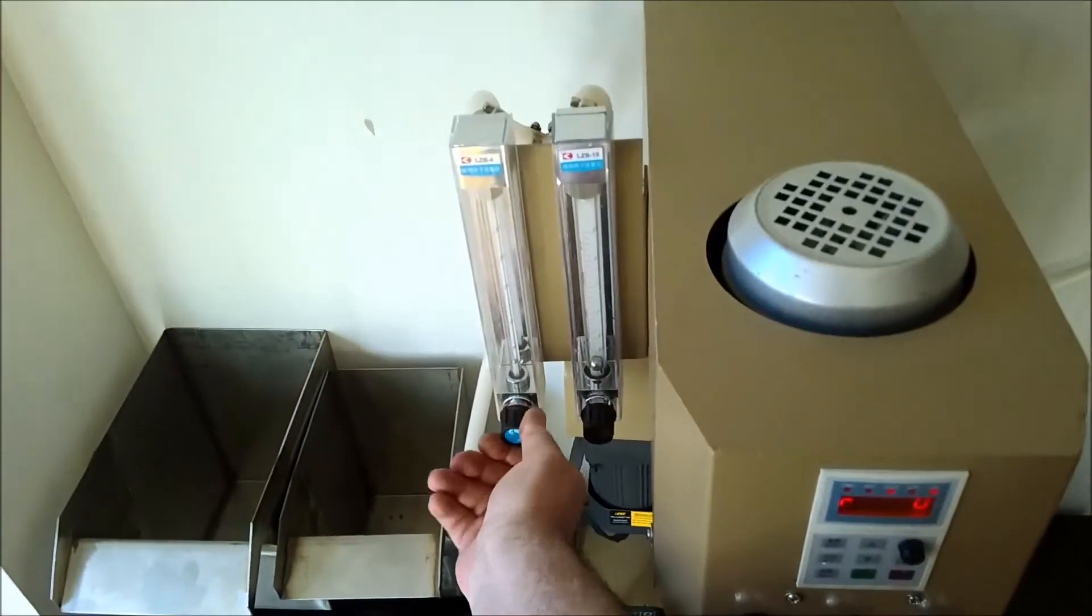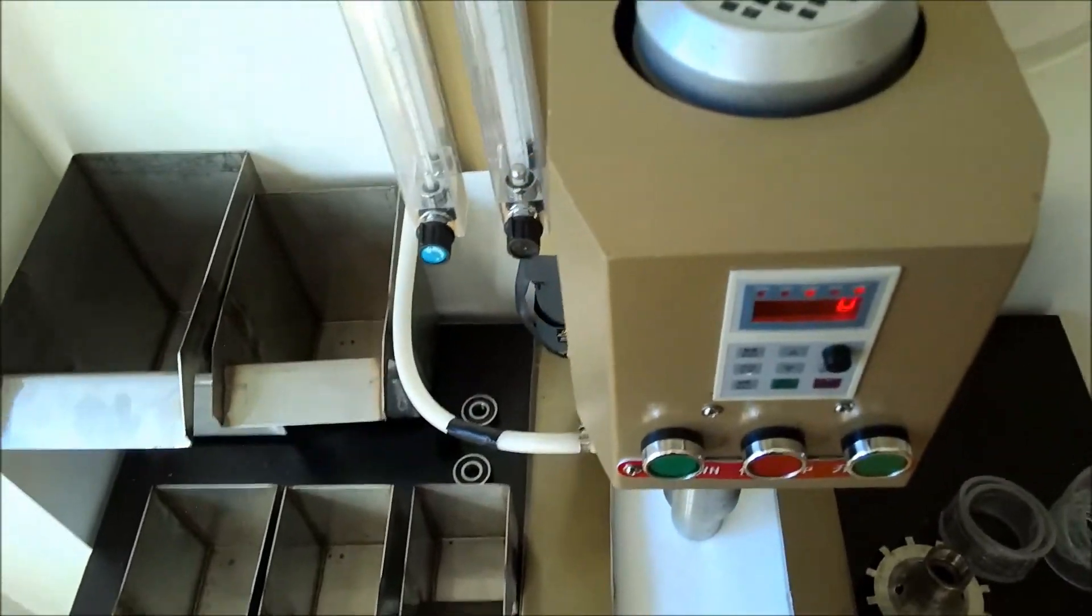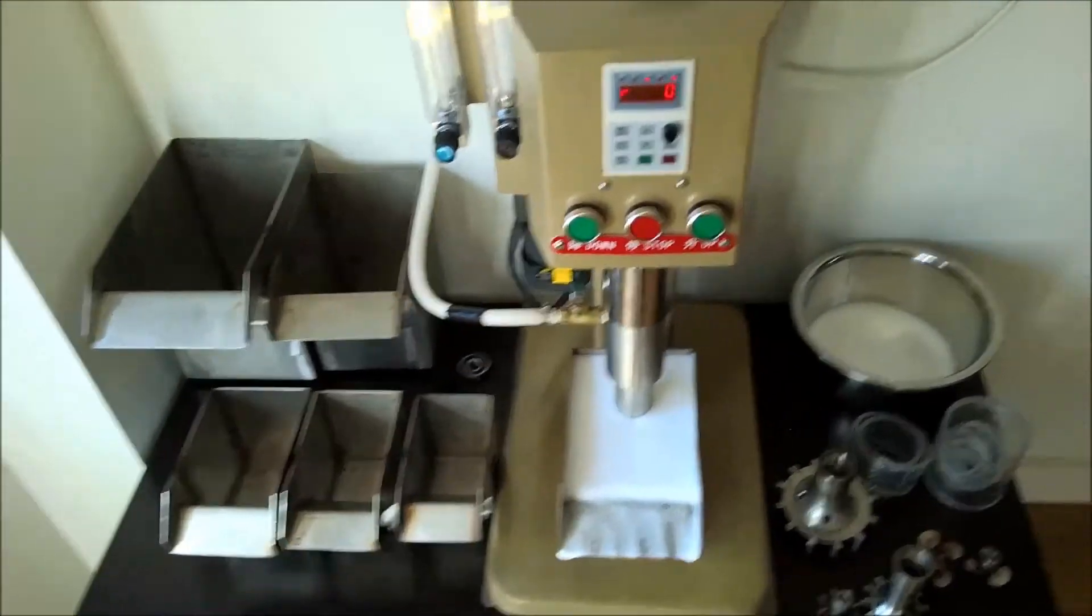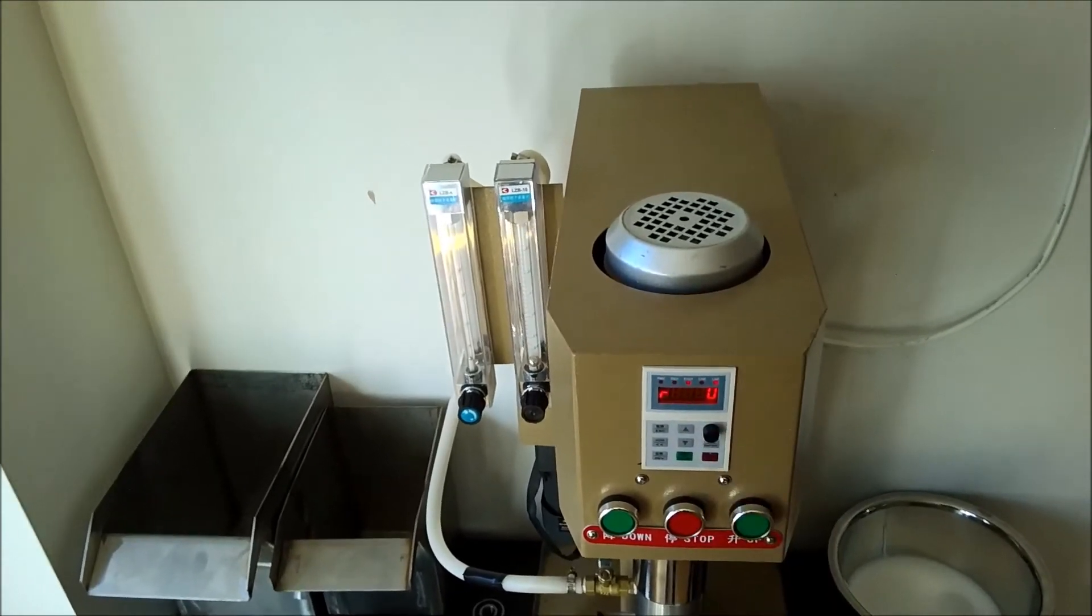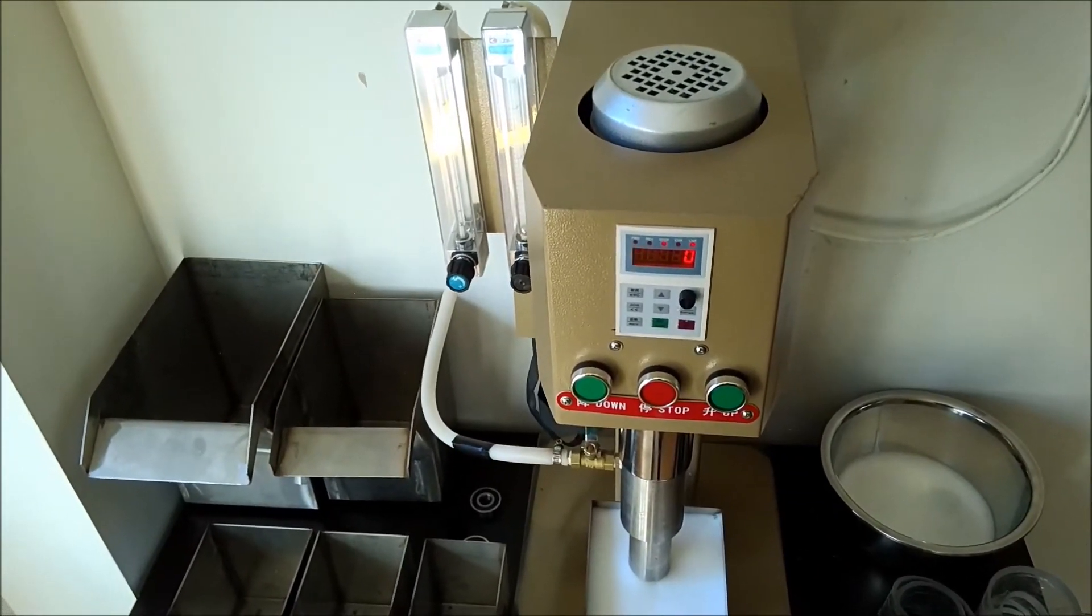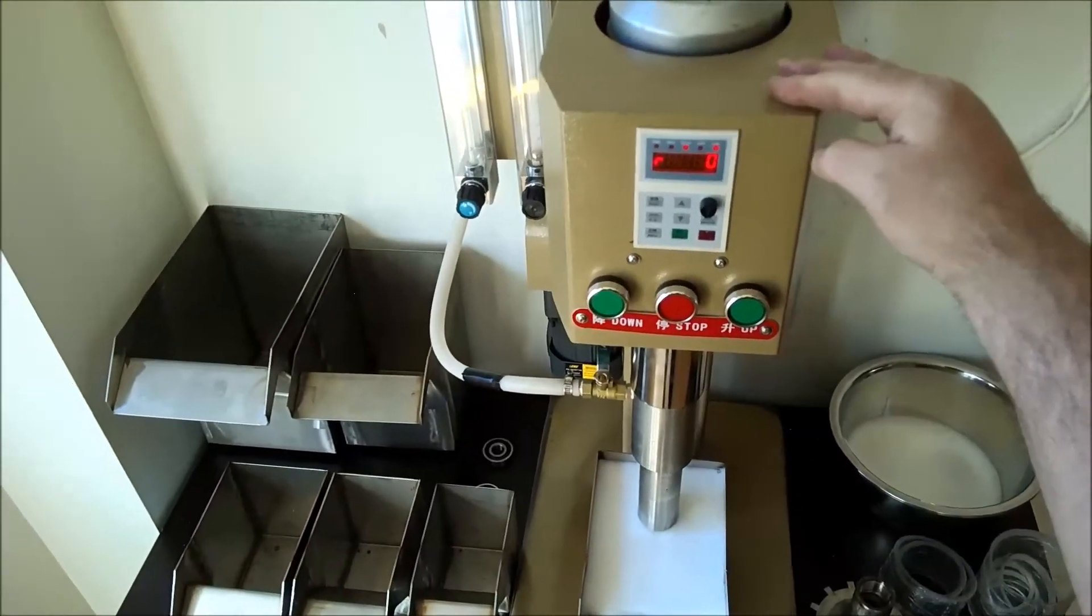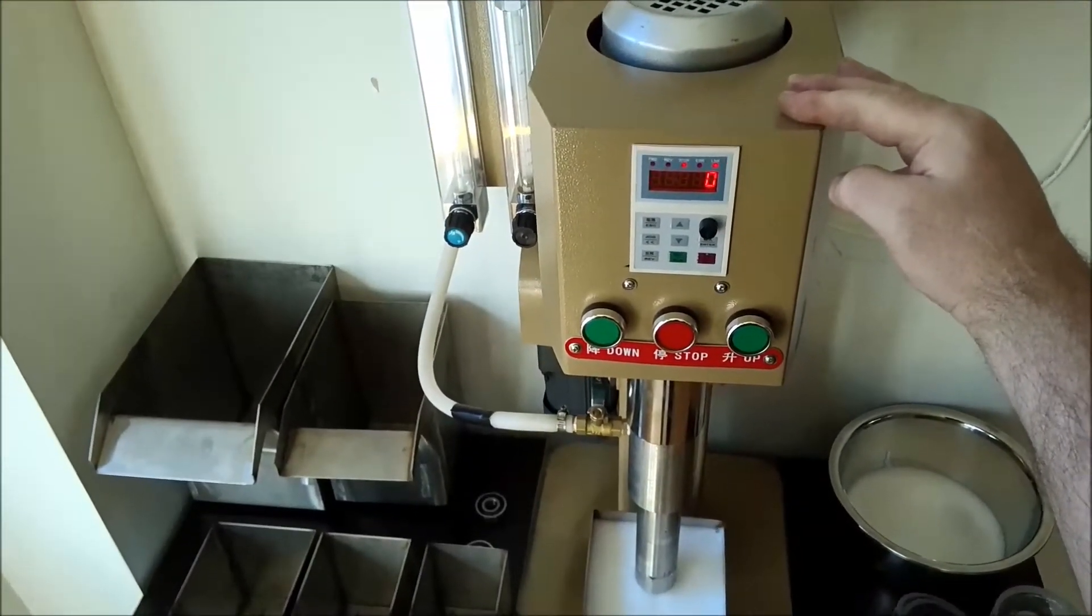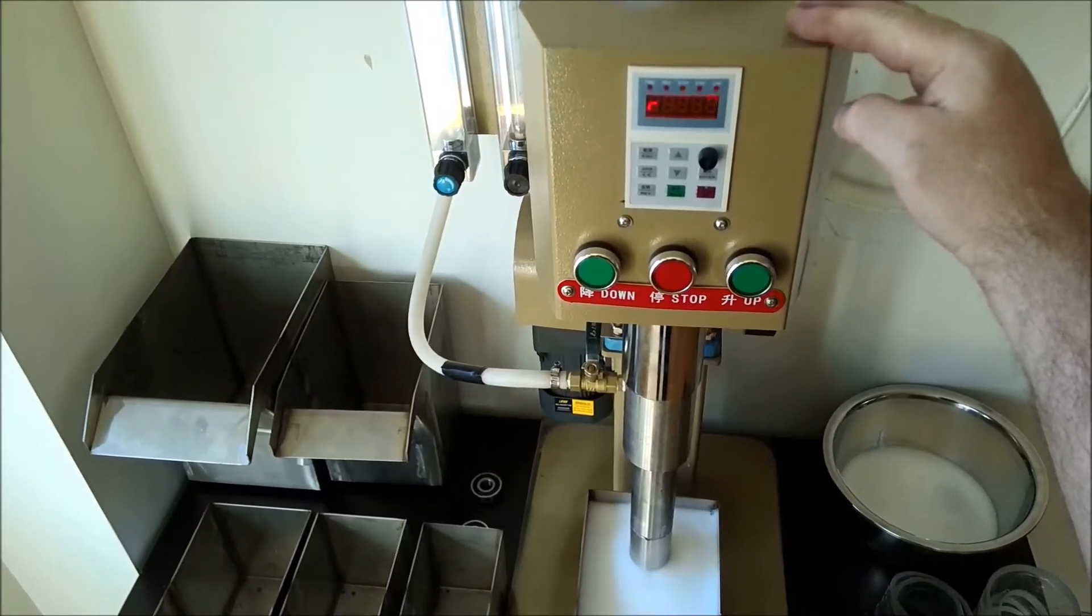So there. In terms of operation, well, I don't have much to say. There's the start, stop, speed, and up and down for speed.